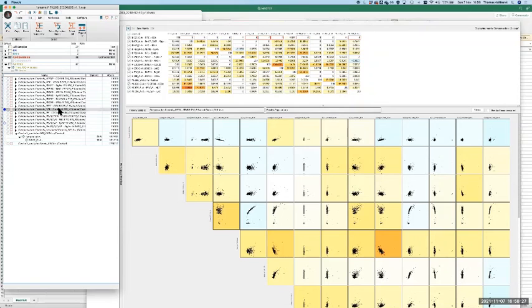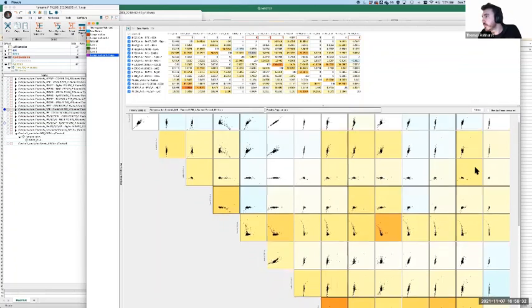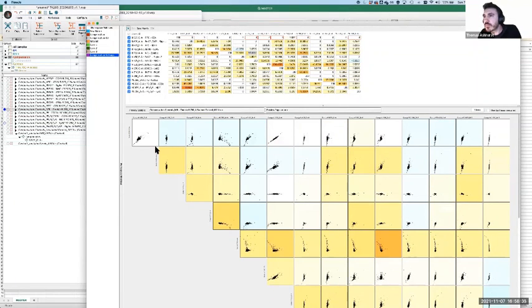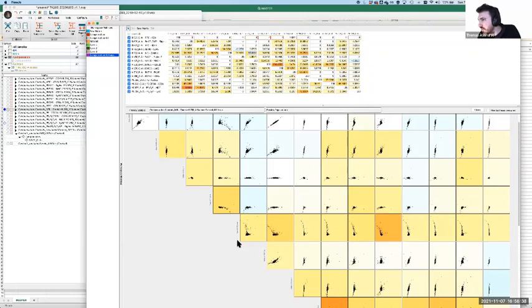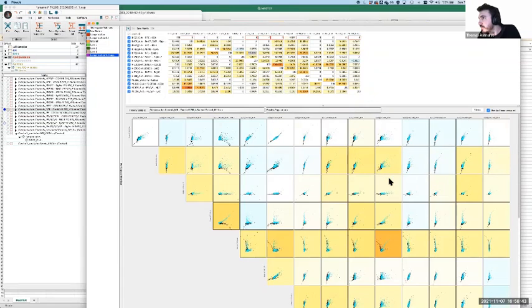So if you go to your compensation control live dead and just look at that on the N by N, what does that look like? Oh, yeah. That sort of makes sense. What does that mean? Yeah, it's definitely being overdone in a couple of places where it shouldn't be. That's a bit weird. Maybe it may have moved the gates down. Yeah, it might have. I didn't check anything else, I just ran a fresh one, so maybe it screwed it up. Either way, I'm pretty sure that works.